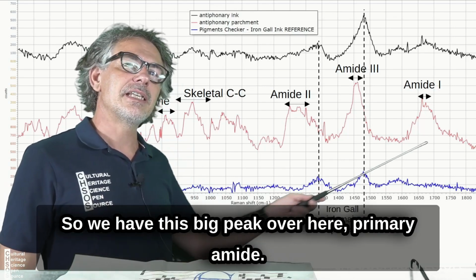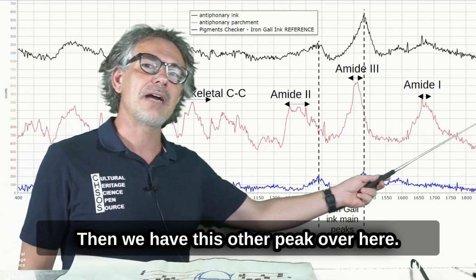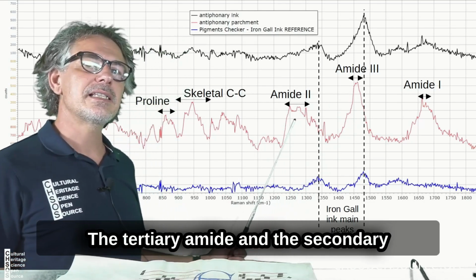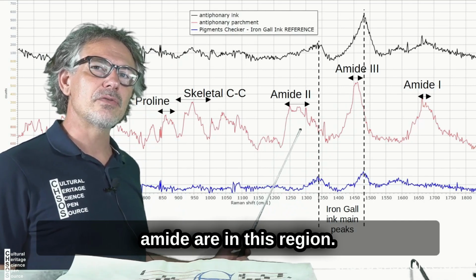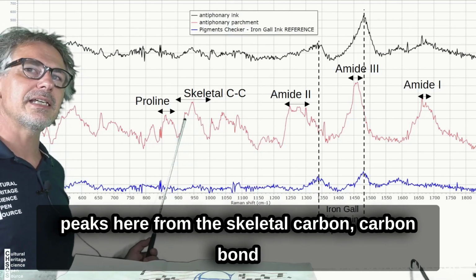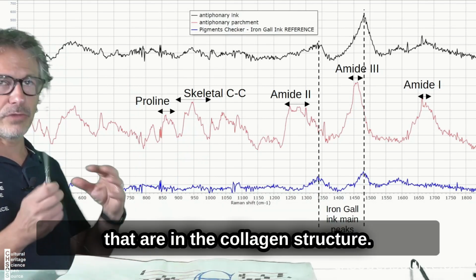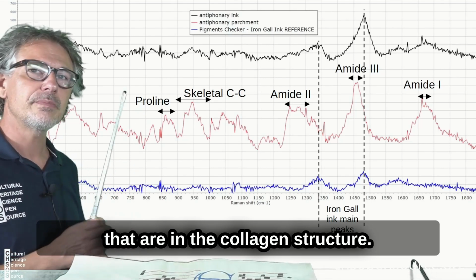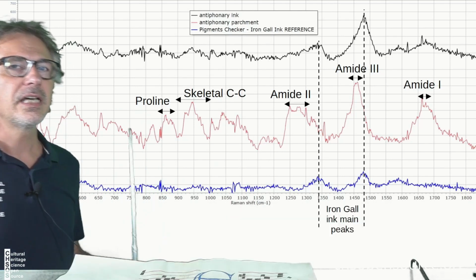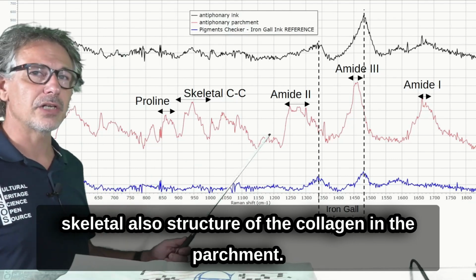Then we have this other peak over here, the tertiary amide, and the secondary amide are in this region. Then we have these other relatively strong peaks here from the skeletal carbon-carbon bonds that are in the collagen structure. And then we have also this peak due to the proline skeletal structure of the collagen in the parchment.